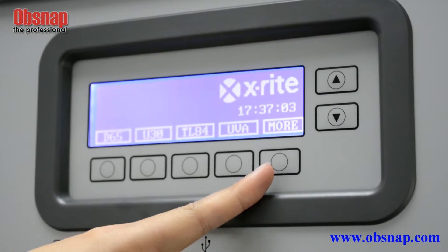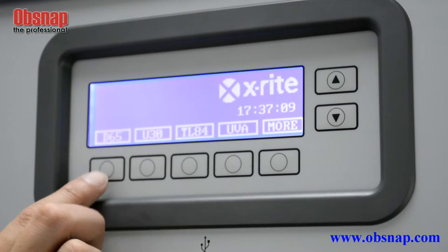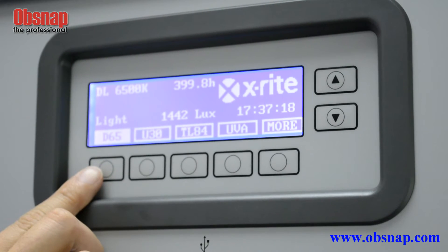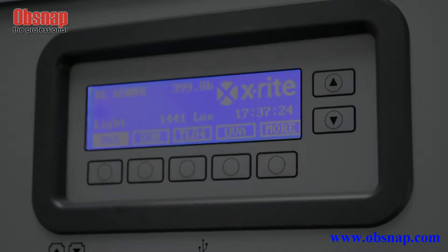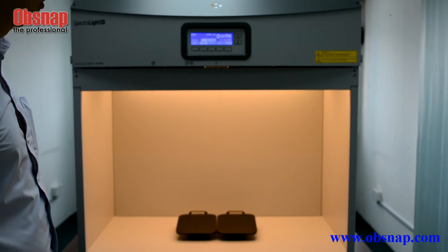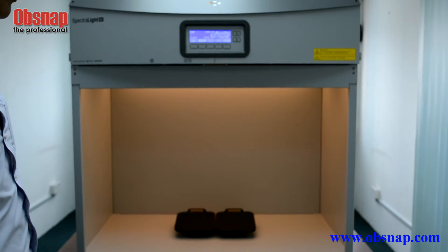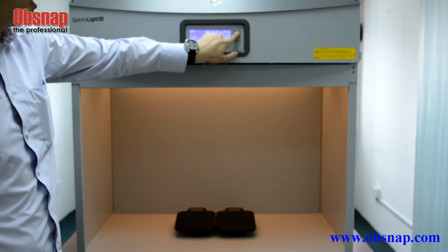This is the selection button for us to select different light sources. First, we select the D65 light source. D65 stands for daylight with 6500 Kelvin temperature, which is approximately equivalent to Malaysia daylight around 12 to 2 PM. We can also select U30, one of three different fluorescent light sources. When we adjust to lower lux, the unit will automatically dim, and we can adjust it to higher lux as well.